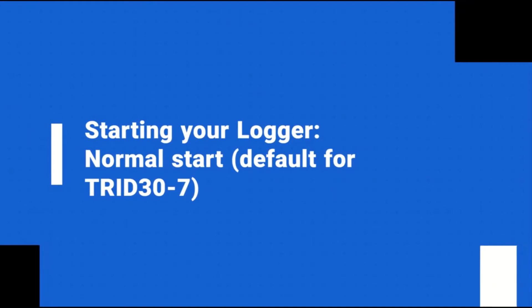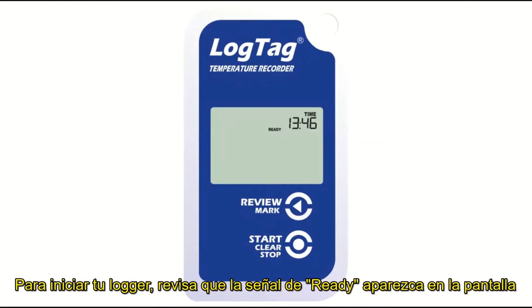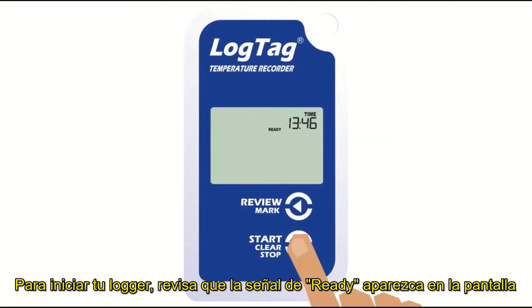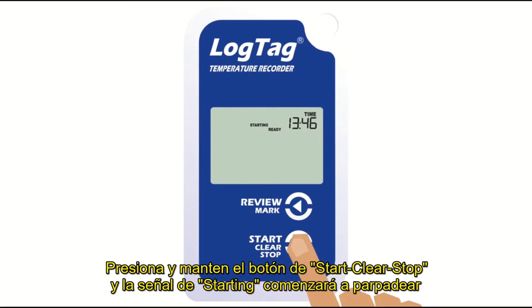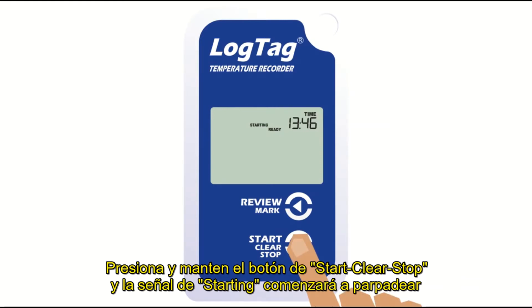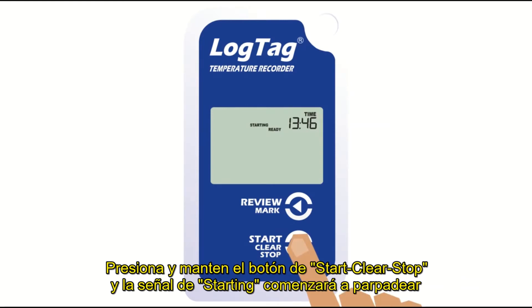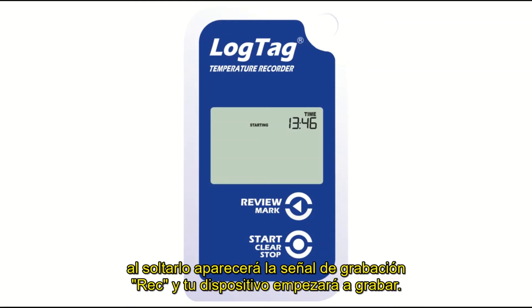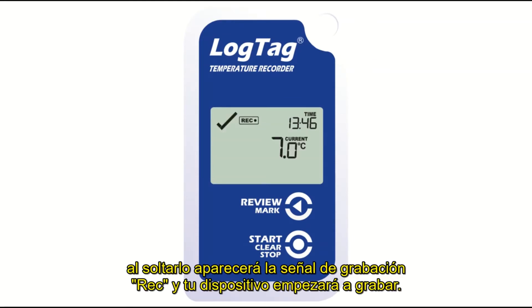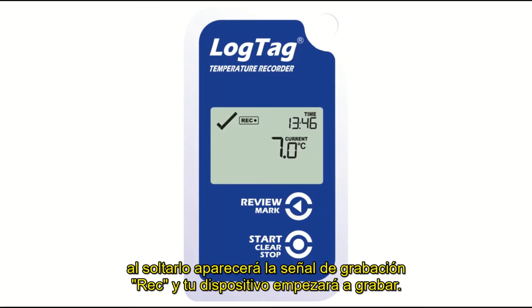To start your logger, check that Ready is showing on the display. Press and hold the Start Clear Stop button. The word Starting will begin flashing on the display. When it stops flashing, release the button and the recording symbol will now display. Your logger is now recording.